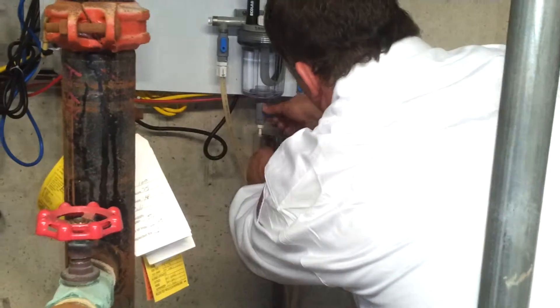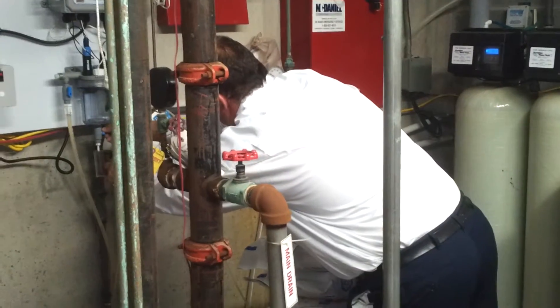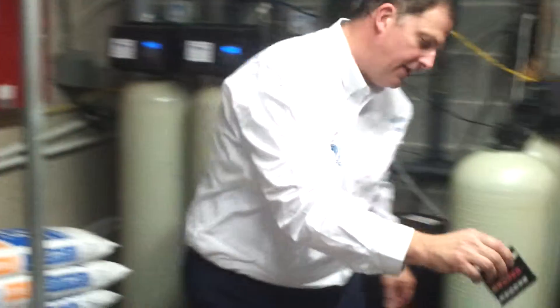The first thing we do is take a sample of water from the sample cell. I always rinse out the jar first, and then take the second sample. We're looking for 10 milliliters.